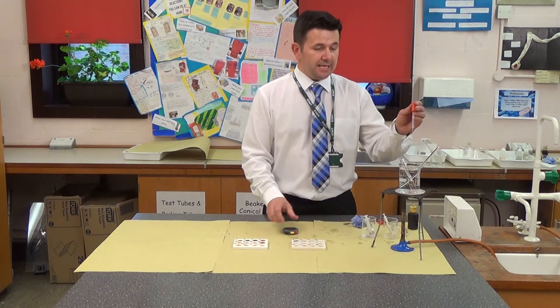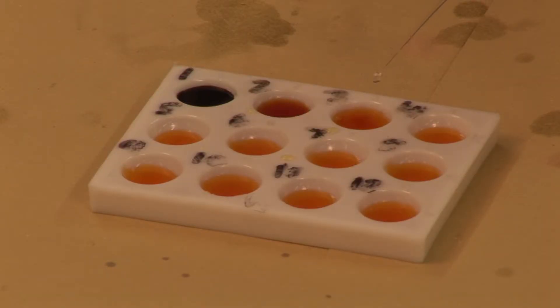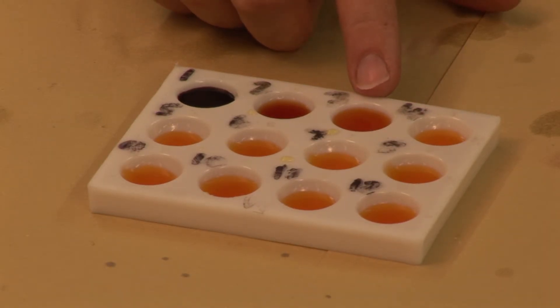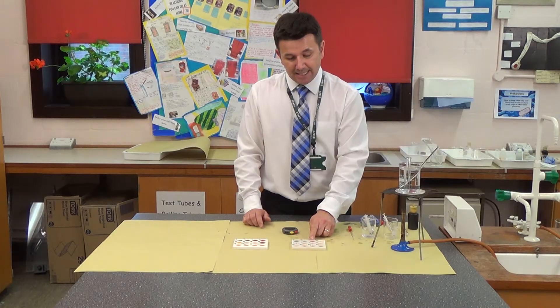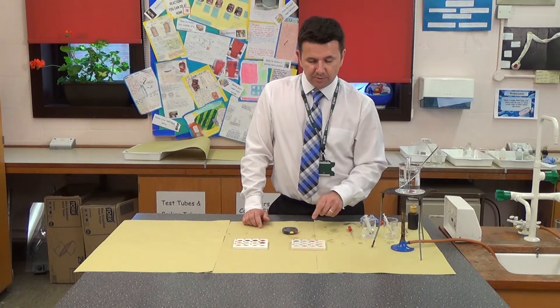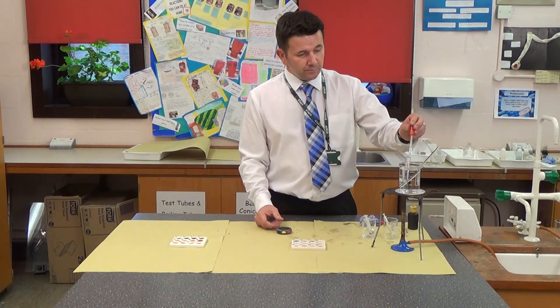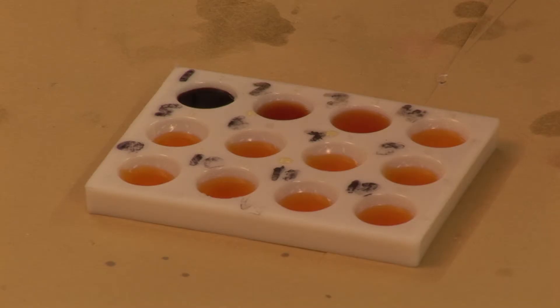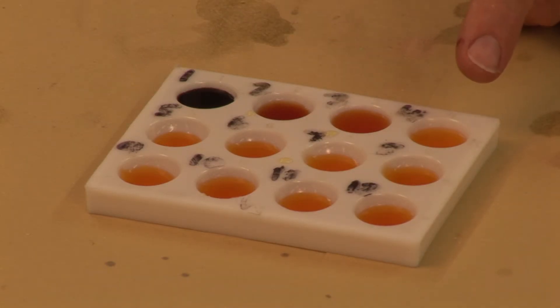After two minutes, I take another sample. There is still a slight colour change, so I keep running until it stops changing colour. It's nearly fully changed colour but I continue because there is still some starch left. After three minutes, I take some more of my sample and add it to the next well. As I add it, there is no colour change — so after three minutes at 47 degrees Celsius, the starch has been fully broken down.